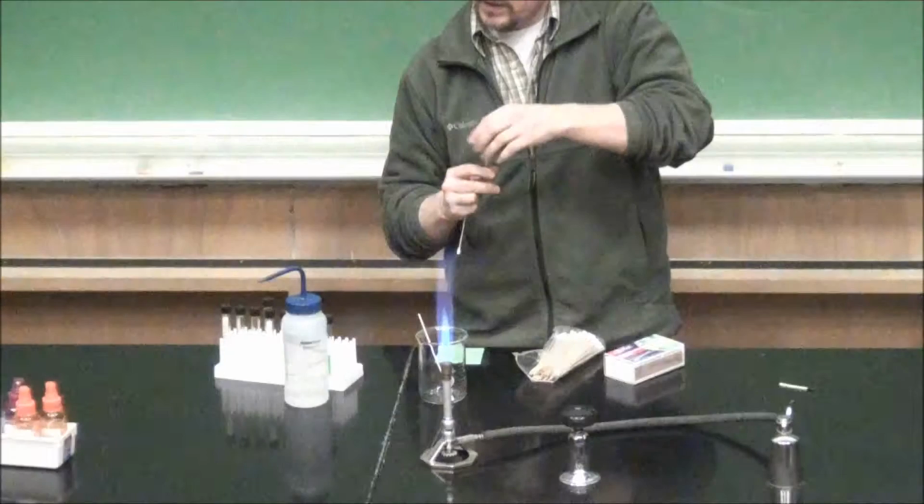Okay, so I'm just going to take metal ions in a solution and put them into the flame. Okay, that one's kind of boring. Hold on. For some reason, the cotton swabs are not absorbing. Let me open that door again. There you go. I don't know what that one is. Let's try this one.